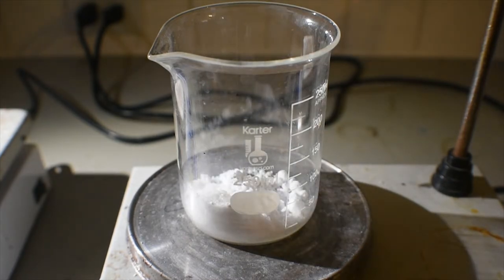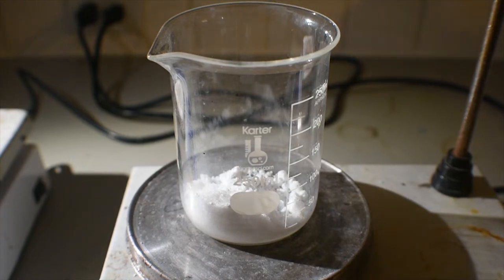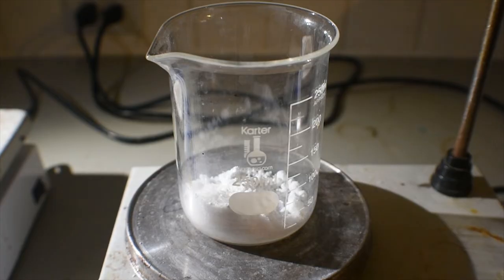This complex does include manganese-3, which is interesting. It's nothing like the acetyl acetonate complex of manganese-3, but it is interesting nonetheless. So, here goes some ice. If I could grab some from this beaker here. Alright, I got a little bit.